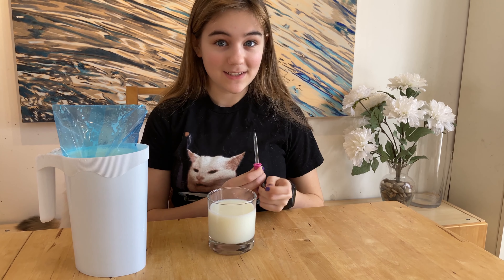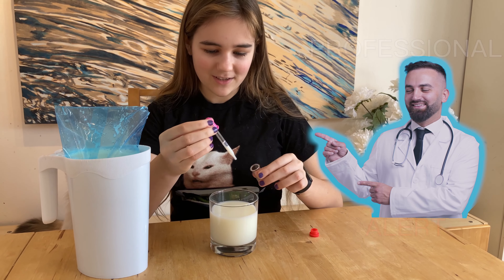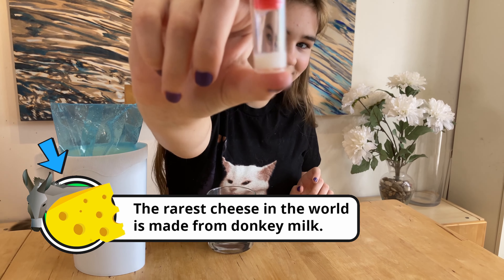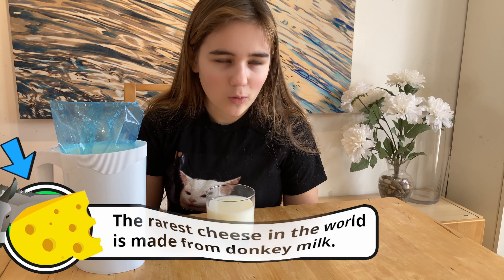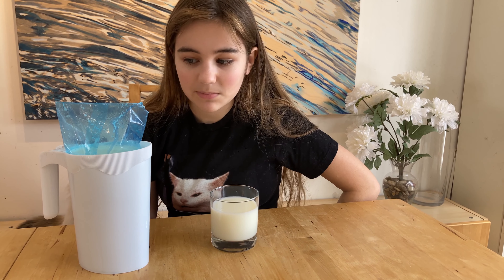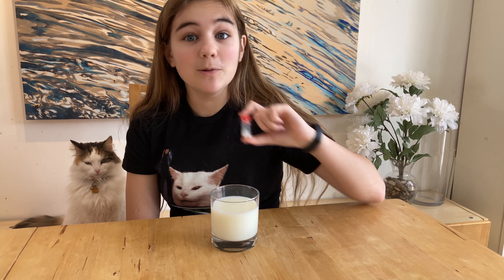Let's see what's inside. Professional alert. Professional alert. Professional alert. I expect it to look a little bit like chalk, or to have particles that stick together. I hope there isn't anything that moves because it's supposed to be pasteurized. Pretty sure it's pasteurized though. Let's get this to the lab.